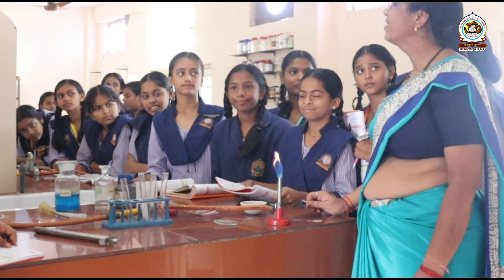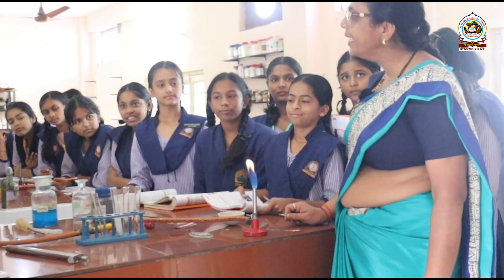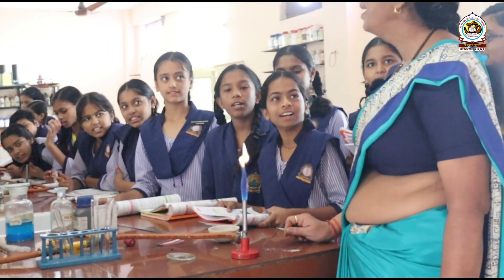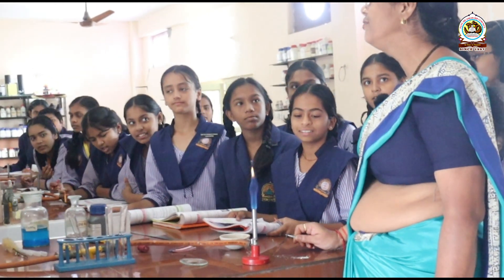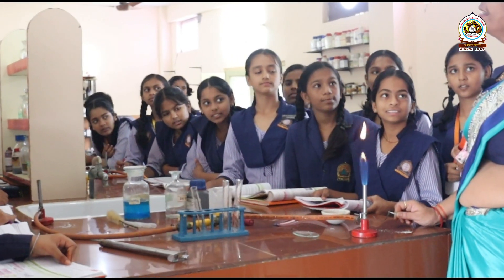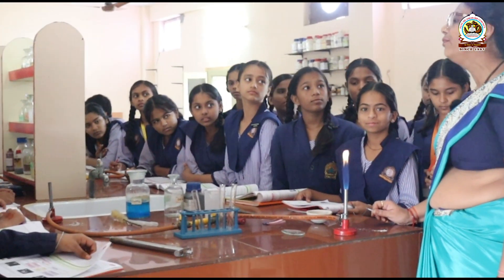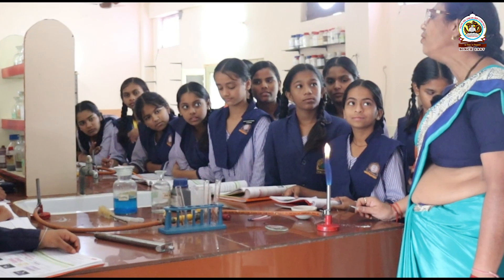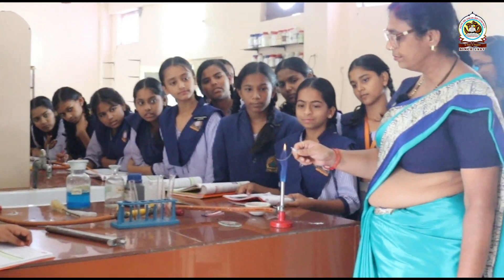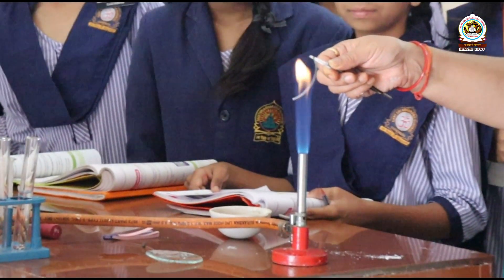We are seeing the reaction of metal with oxygen. Here we are taking magnesium as the example and we are burning the magnesium in the presence of oxygen. See, the white light will come.